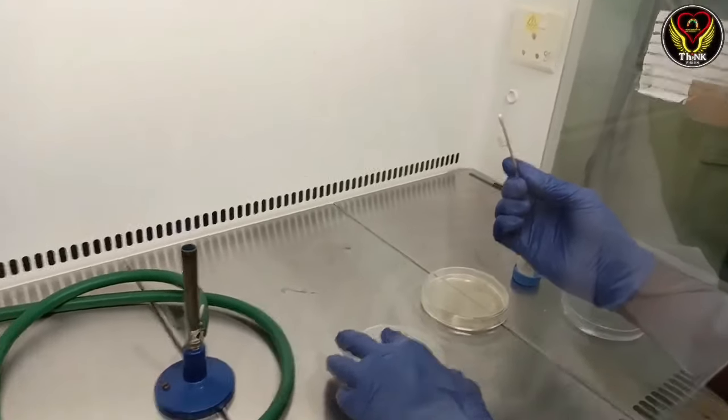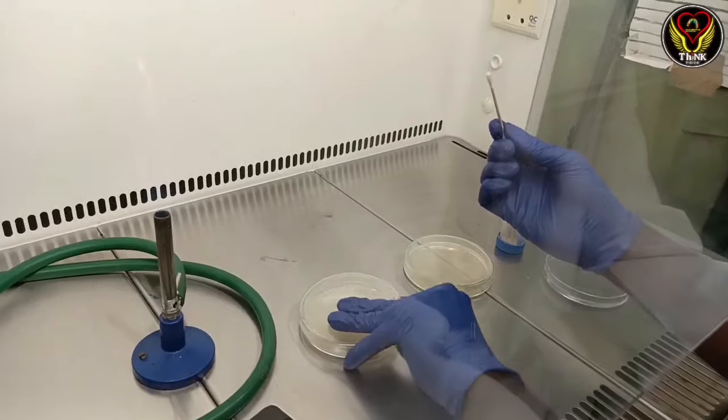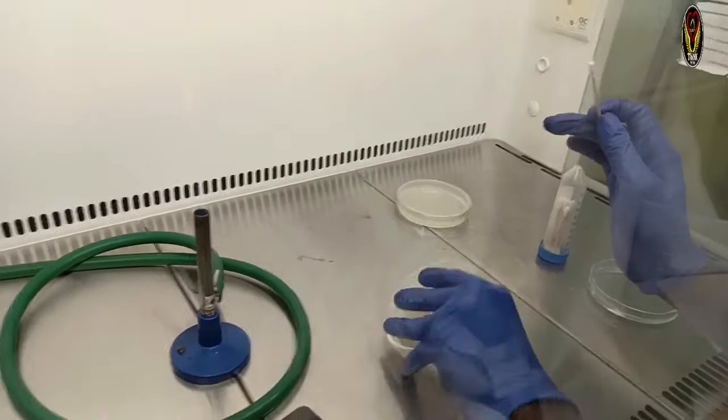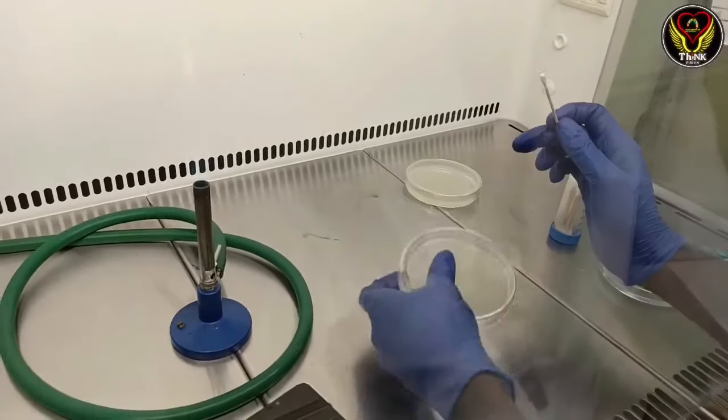Now I will take a plate. First, check the plate or control plate. We need to work on the control plate. Now I will take the plate.